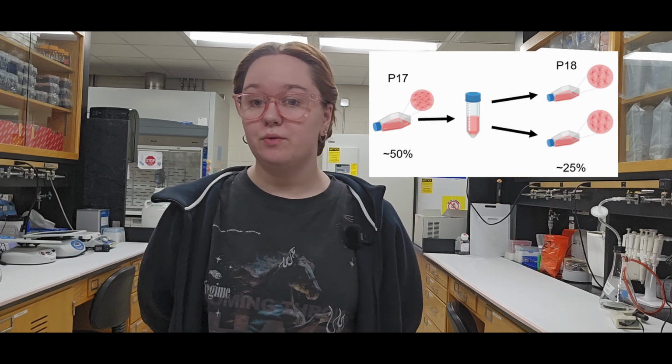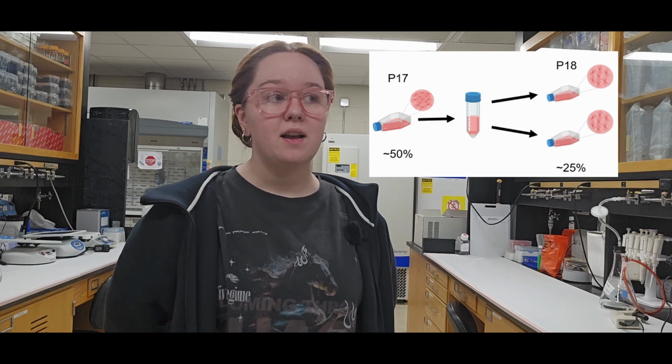Passaging at anything below 80 to 90% is not really the most efficient way to grow out cells. Especially if you're growing out for a cell bank, you would want to let that flask reach 80 to 90% and then split into more vessels. Today, I'm just taking that one T75 flask and splitting it into two T75 flasks just for demonstration purposes. So if the T75 flask in that incubator is currently at around 50% confluency and I'm splitting into two new T75 flasks, then I will have a 25% seeding density.